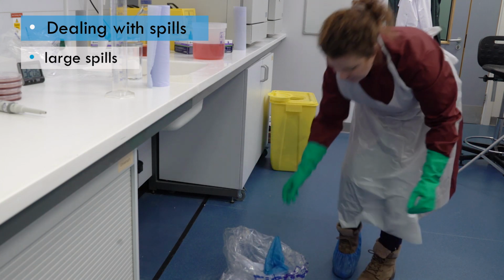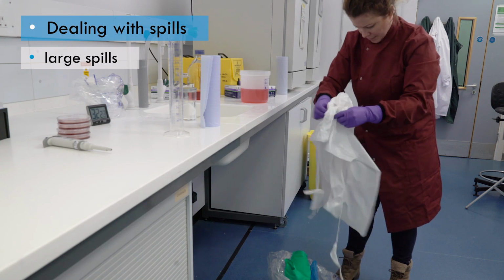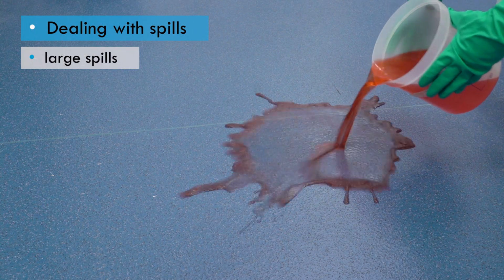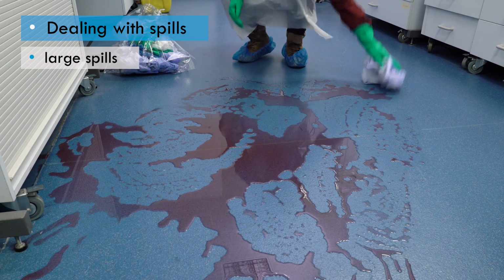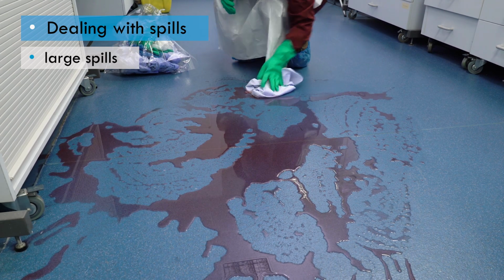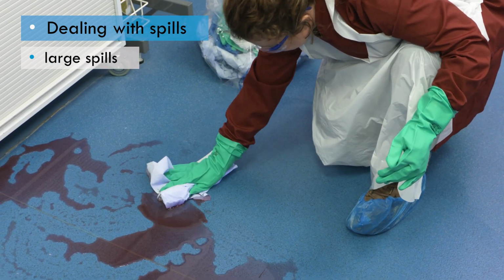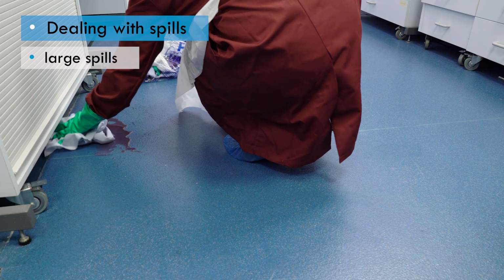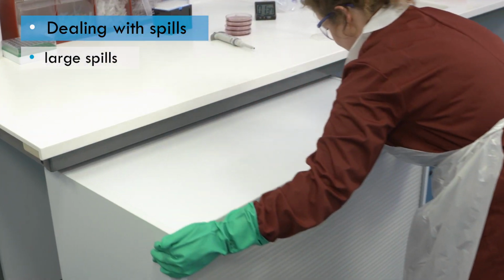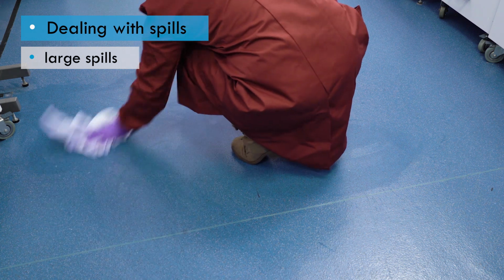Once the spill has been mopped up, change gloves and other PPE to avoid cross-contamination. The spill area can then be decontaminated with disinfectant, following the general guidelines. Where a large volume of proteinaceous material has been spilled, such as blood or broth, the disinfectant concentration and the contact time may need to be increased. In addition, the disinfectant should be applied to a wider area than the spill. You may need to move furniture or equipment to make sure you have located all of the spilled material. The surface must be dry before work is resumed.